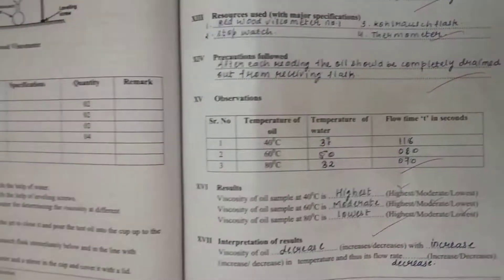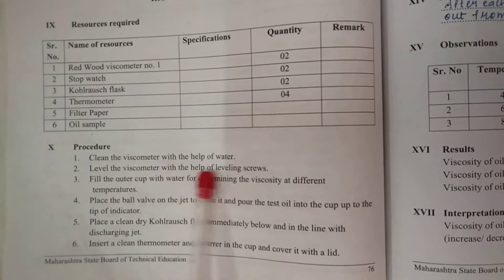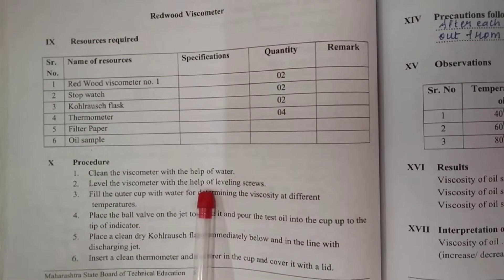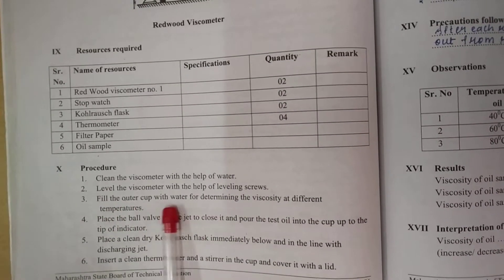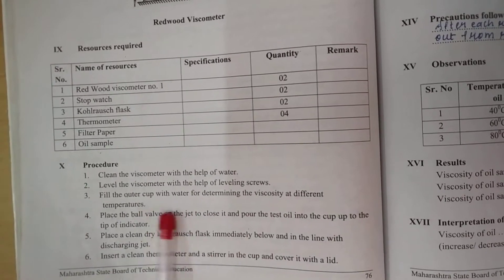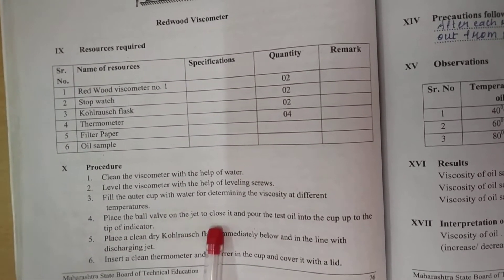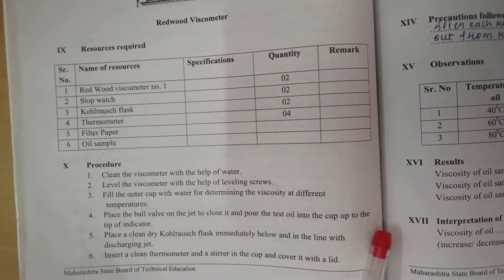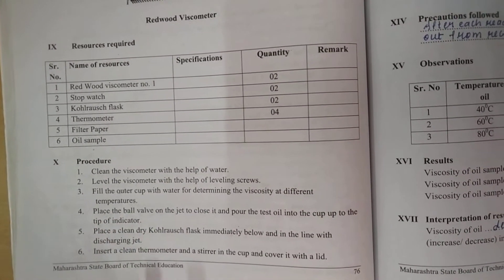What is the procedure? Clean the viscometer with the help of water. Level the viscometer with the help of the leveling screw. Fill the cup with water. Determine the viscosity at different temperatures. Place the ball valve on the jet so it is closed, and pour the test oil into the cup.